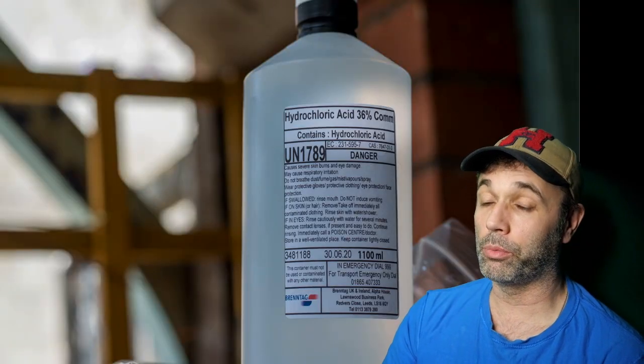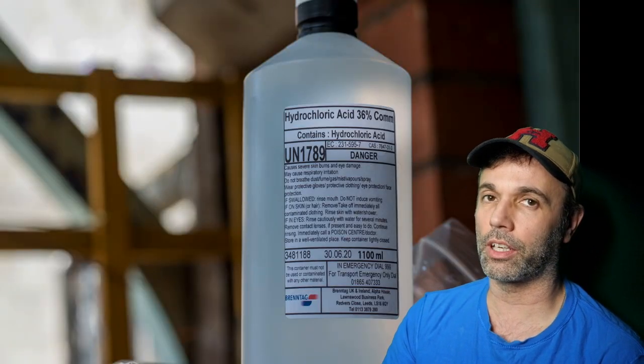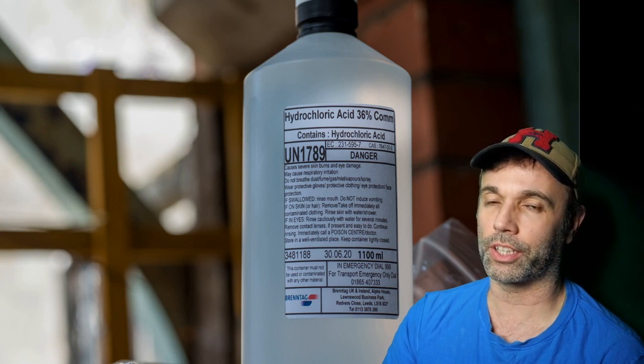After we've done those calculations, we'll come back down here, I'll put on the lab coat, we'll pour out the acid, put it in bottles, and we'll actually see how it's practically done. We want to use this acid for school experiments, so we want something like 1 molar strength hydrochloric acid.